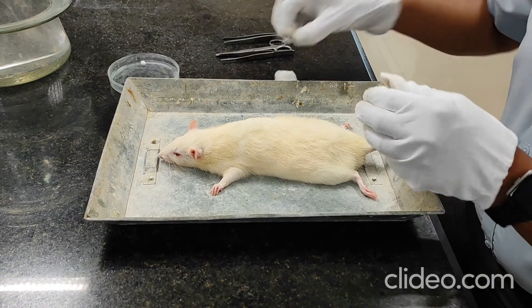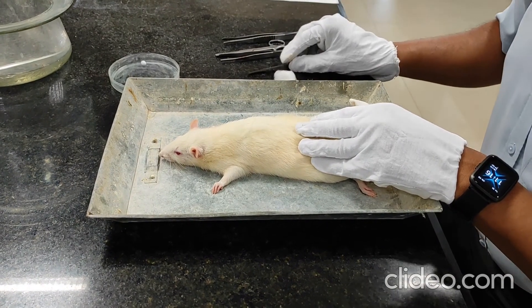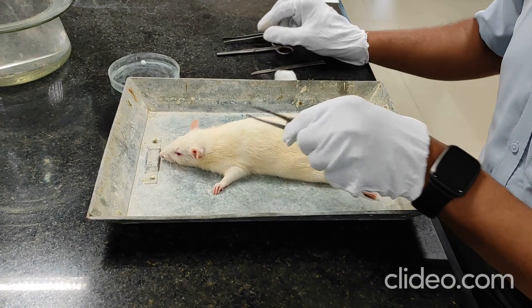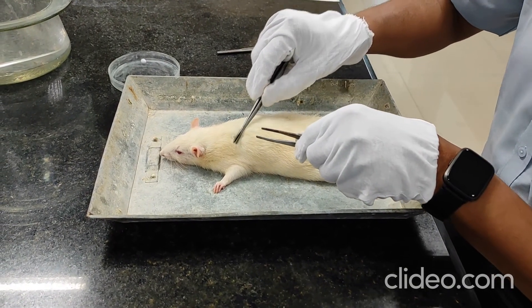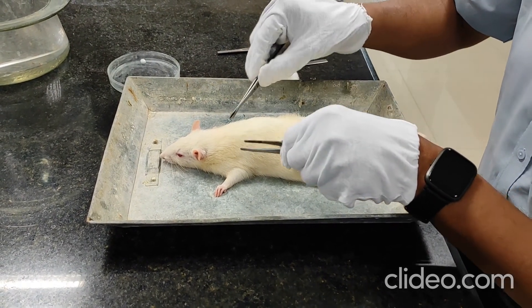After that, give a small cut of approximately 1 to 2 cm. Then pull the skin portion and make a subcutaneous pouch on both sides from the subcutaneous layer.